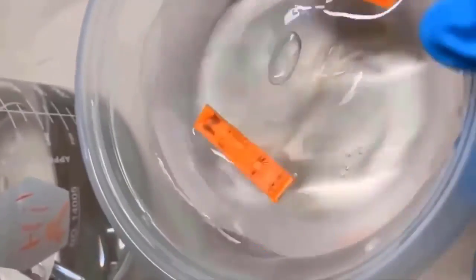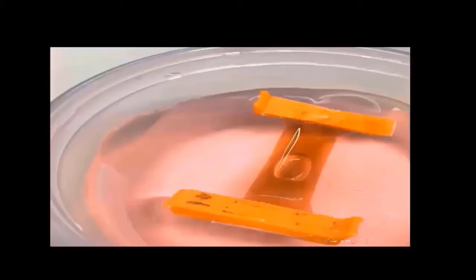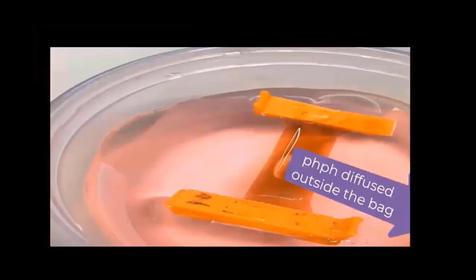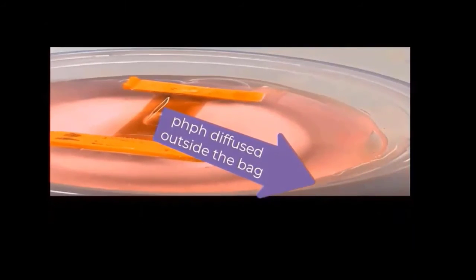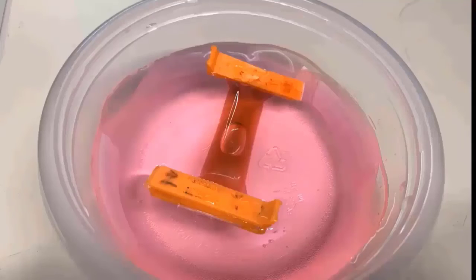And outside of the bag, I poured NaOH, that is a strong base. After 20 minutes pass, as you see here, inside and outside turn to a pink color. The pink color of outside of the bag indicates the presence of the phenolphthalein. That means phenolphthalein molecules diffuse through the membrane and turn the outside solution pink.